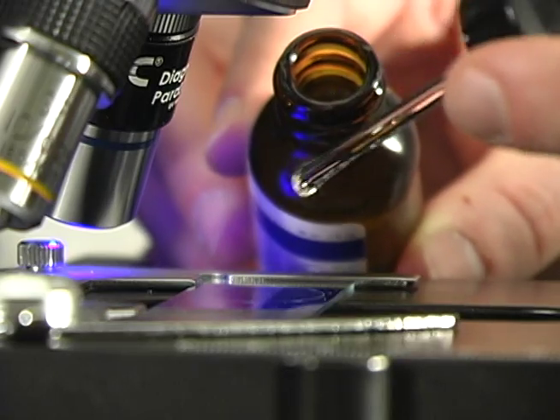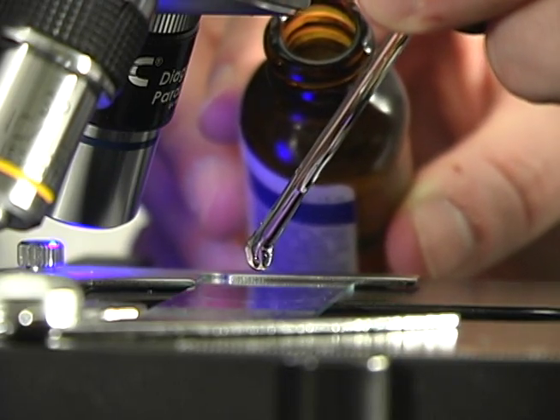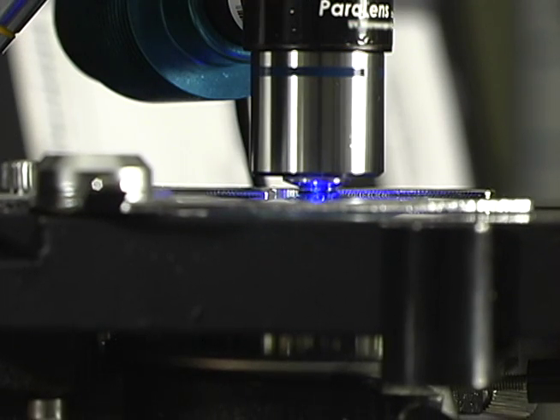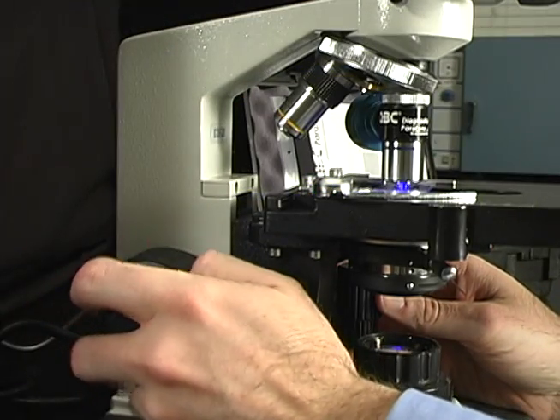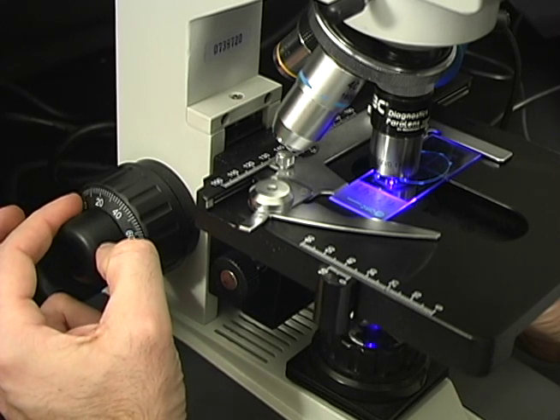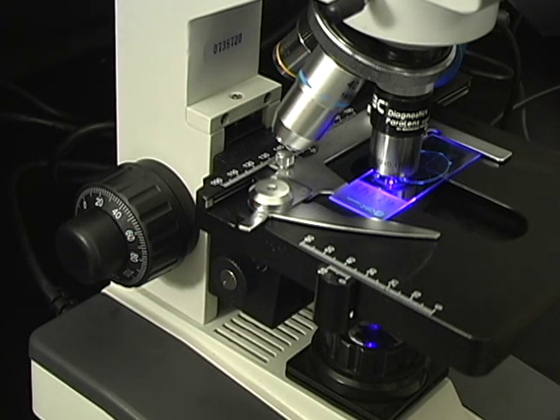If using the 60x or 100x objective, add immersion oil to the smeared area of the slide, and slowly bring the attached objective down into the oil. As soon as the objective is directly inside the oil, use the fine focus knob to adjust the objective so that the slide becomes in focus.